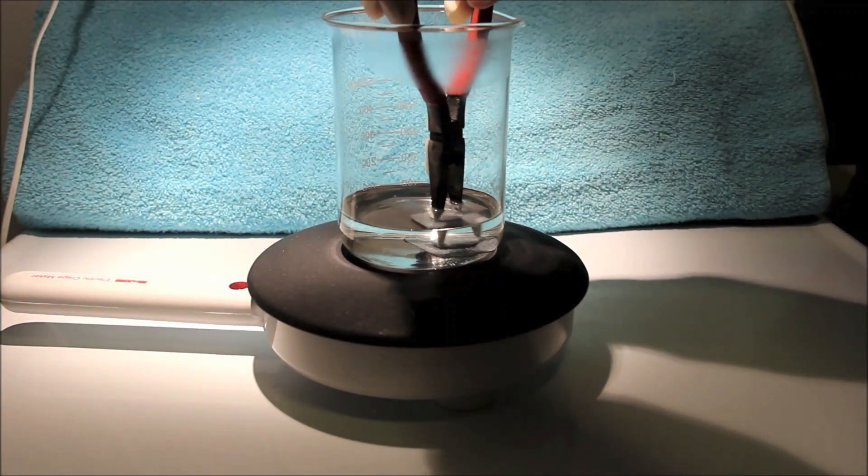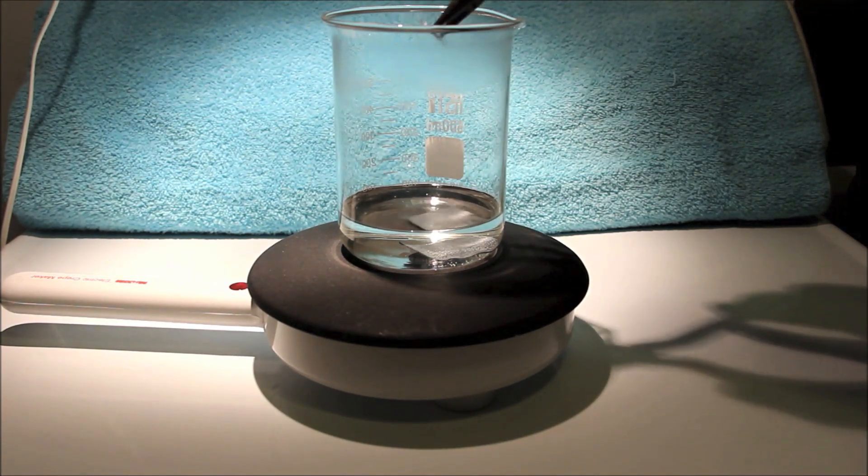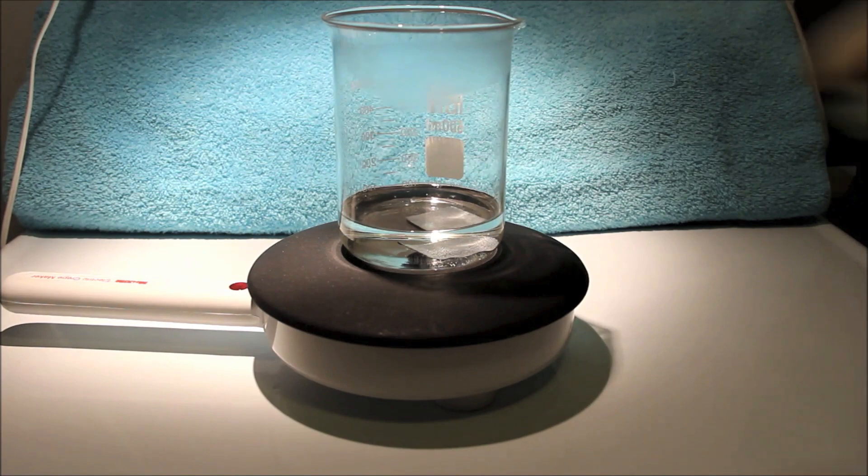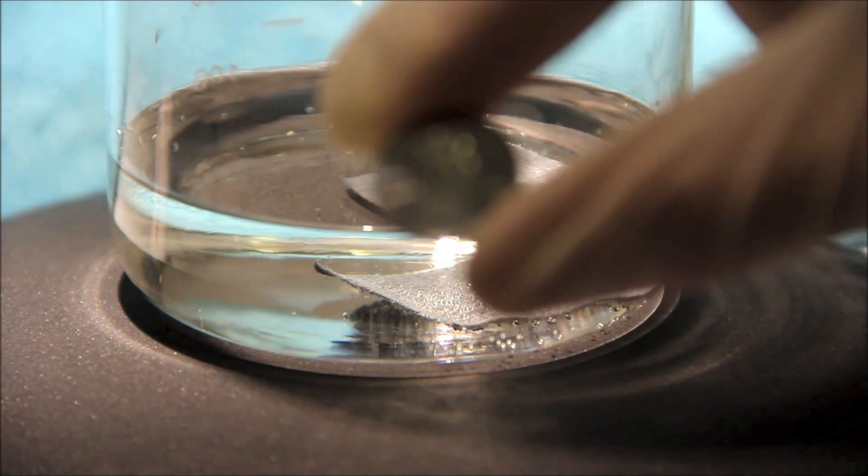I'll remove the penny from the solution and wash it. And here it is. It is clearly silver colored now.